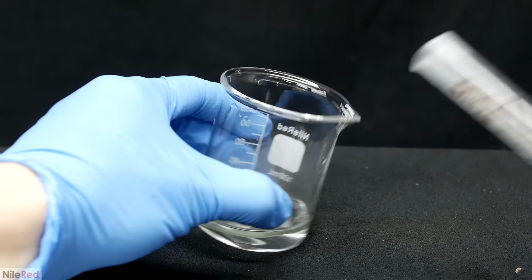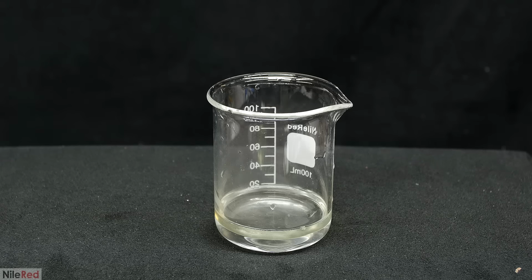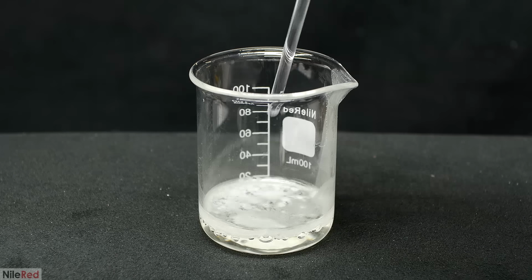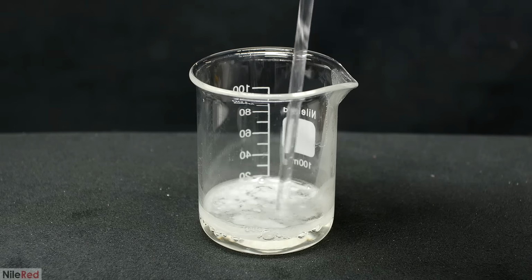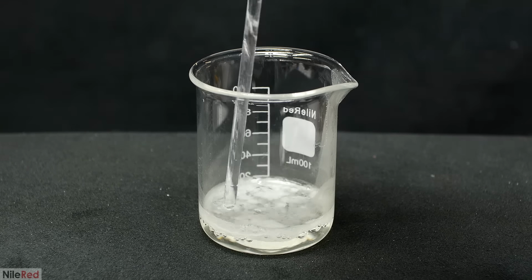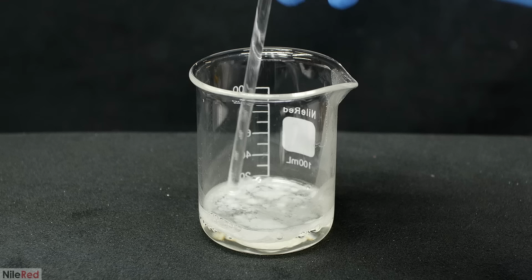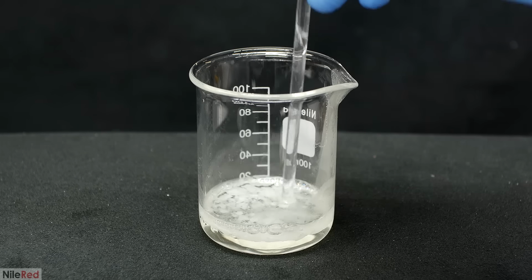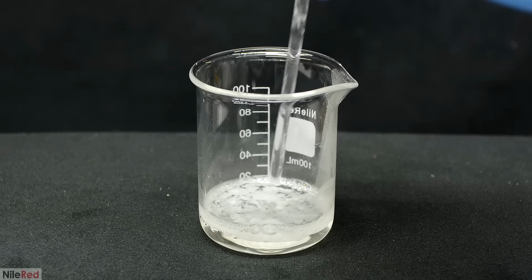In another run, I just poured in the adipoyl chloride and then did absolutely nothing. I left it for about an hour and I wanted to see what would happen if I just let it react passively. When I came back, the adipoyl chloride layer was no longer yellow. I poked around with a glass stir rod and tried to pull some nylon using tweezers, but it appeared that everything had reacted. What's interesting is the same amount of nylon has formed here as all of the other runs.